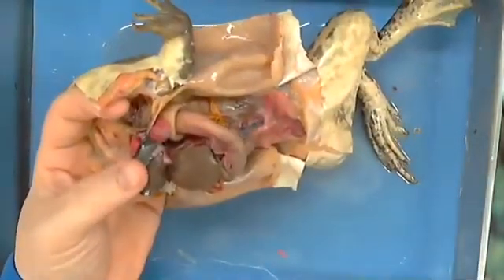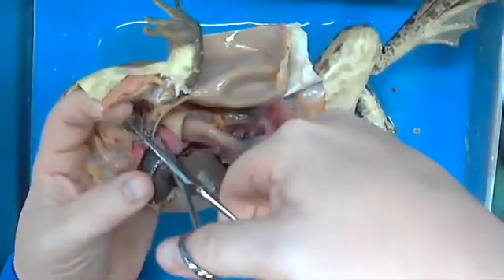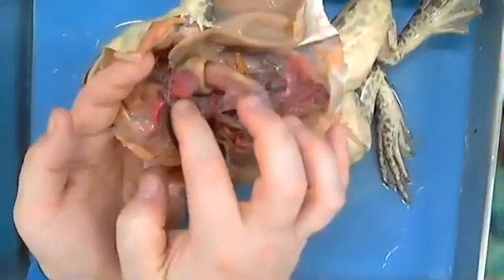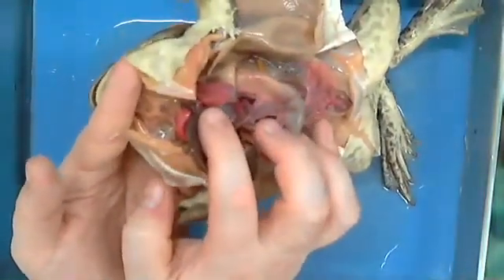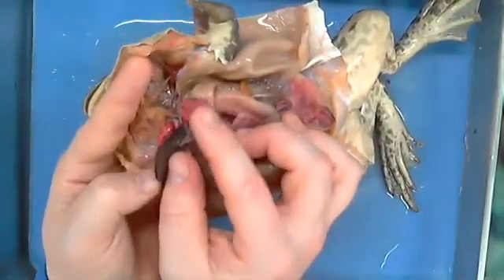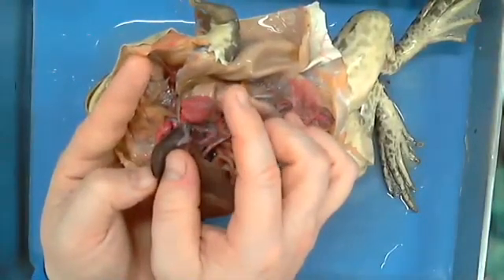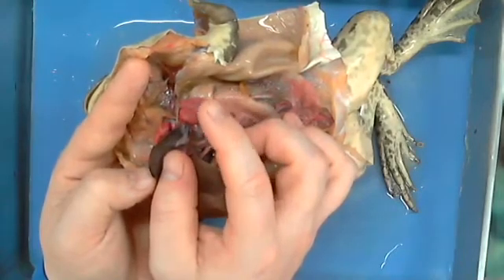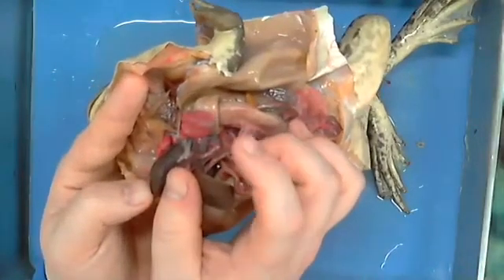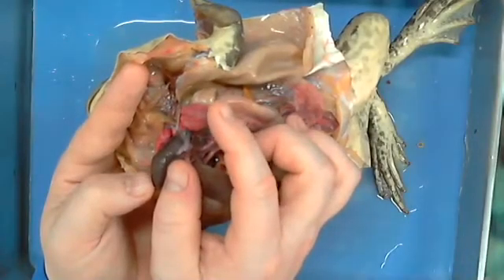So let's look at this thing that happens to be sitting underneath him right here, and it's very pink. Why? What is this? What would have lots of blood? Pancreas? Nope, not a pancreas. He has two of these, by the way. Kidney? Lungs. His lungs. There we go. So this is his lung.